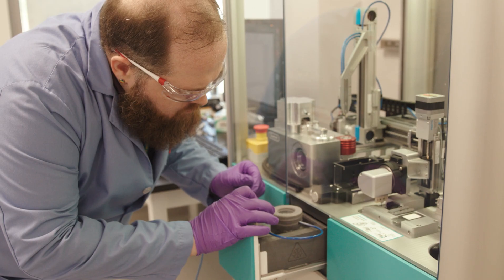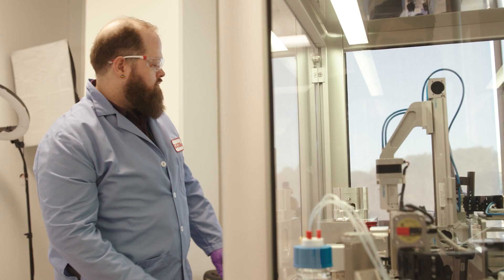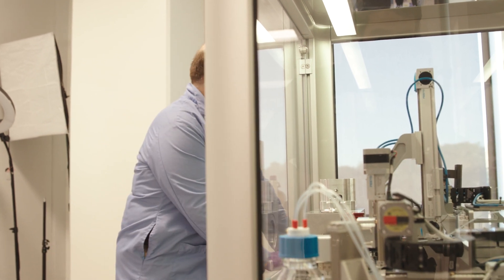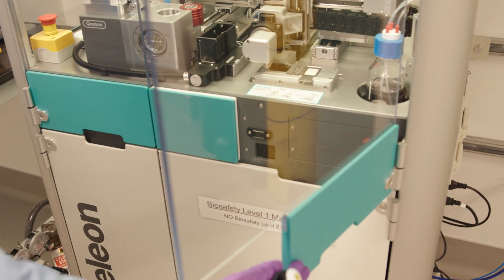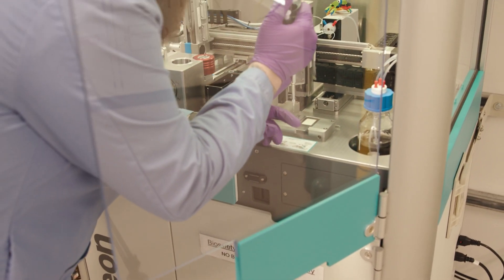Together, we consider this really being a one-stop shop for structural molecular biology work. We are the biggest in the U.S. in that we have a very large collection — a suite of high-performing instruments. We have supporting capabilities in labs, other instrumentation, and computation capabilities, as well as a high level of expertise.